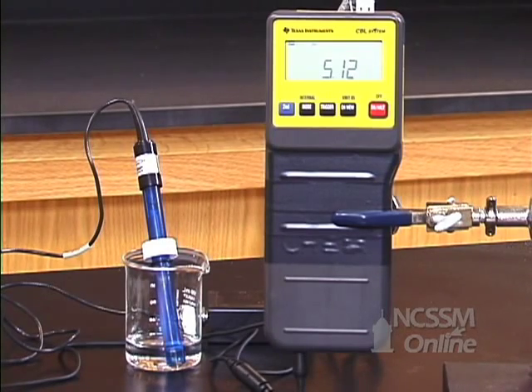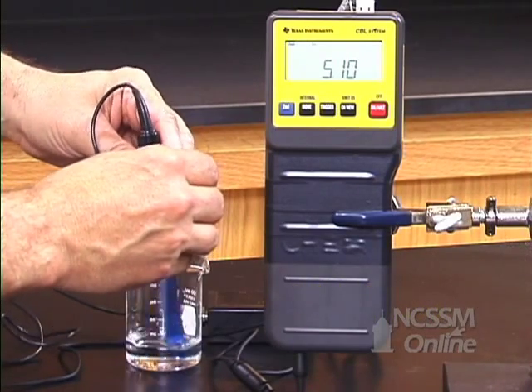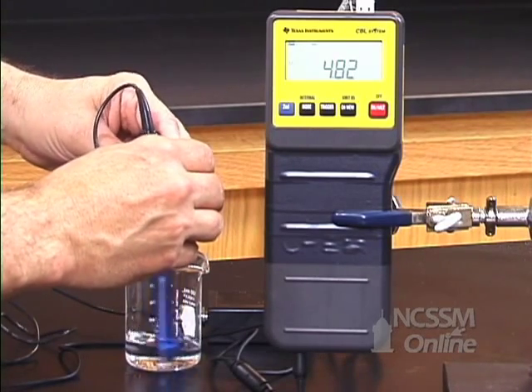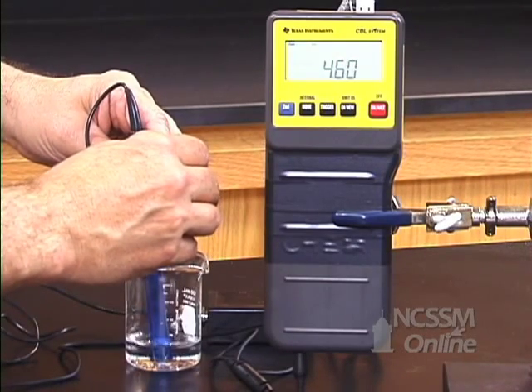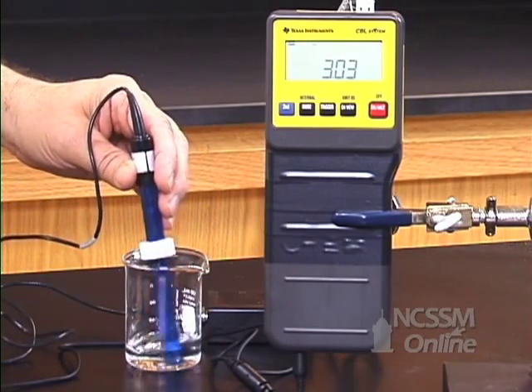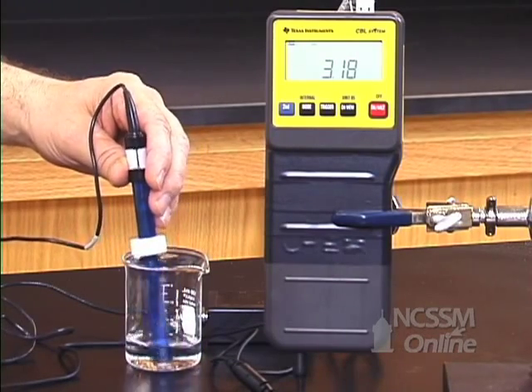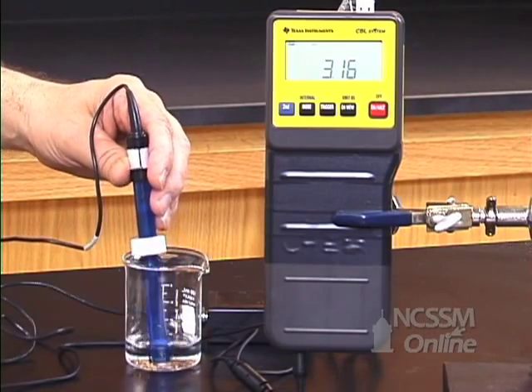I will now add 1 molar HCl to the buffer. Notice that I have added 5 drops of 1 molar HCl. Notice that the pH of the buffer has dropped very rapidly. The two buffers have the same initial pH, but the 0.01 molar buffer has a much lower buffer capacity.